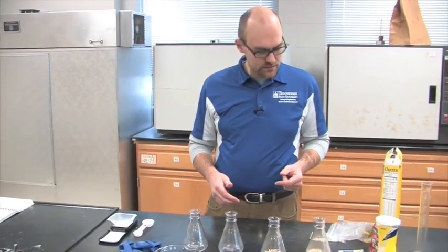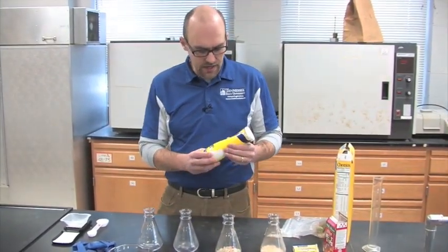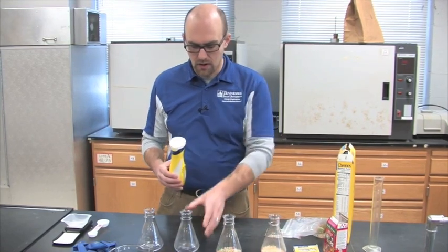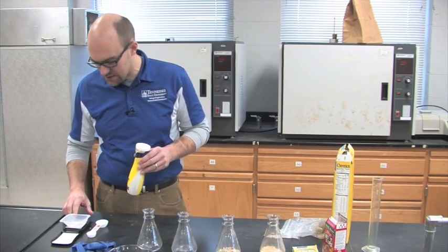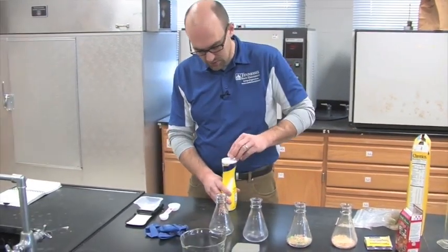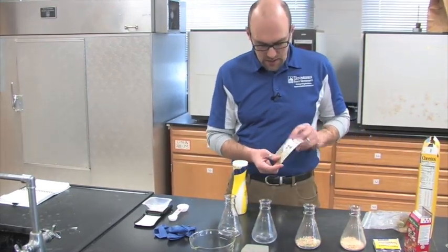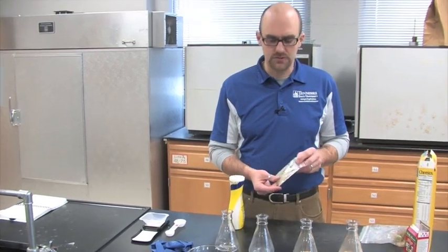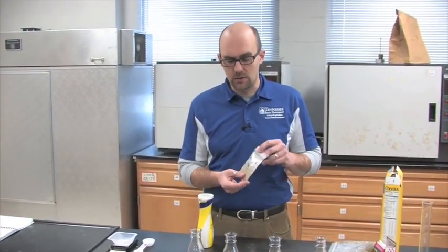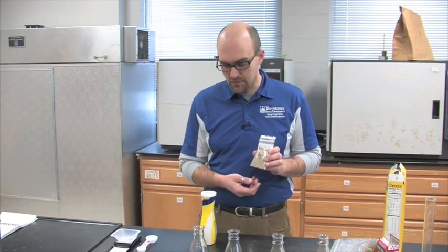Next we've got the sugar. The sugar is already ground down into fairly small particles, so essentially all I need to do is weigh out eight grams and place it in its own flask. With the switchgrass, it has already been dried and ground down to a fine particle size and pre-weighed to eight grams, so for this one I'm just going to open up the bag and pour it into its flask.